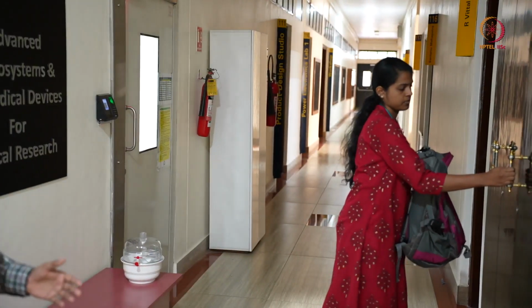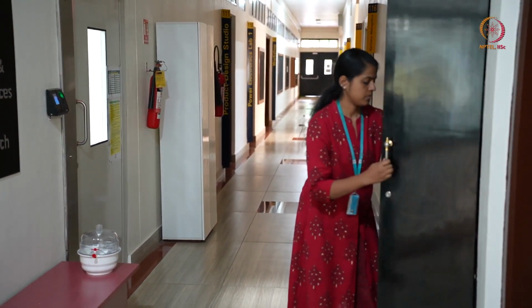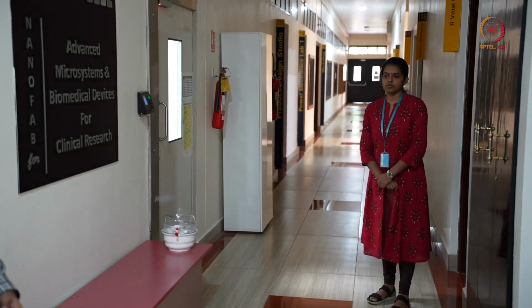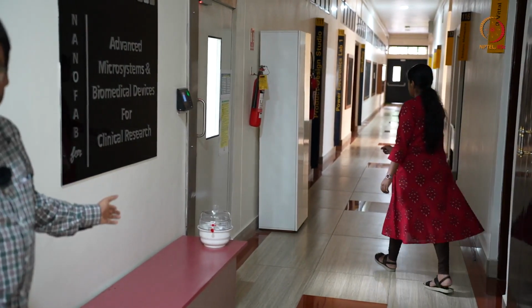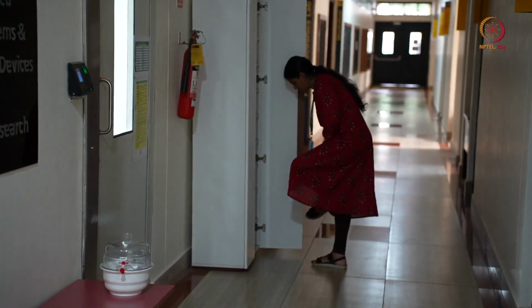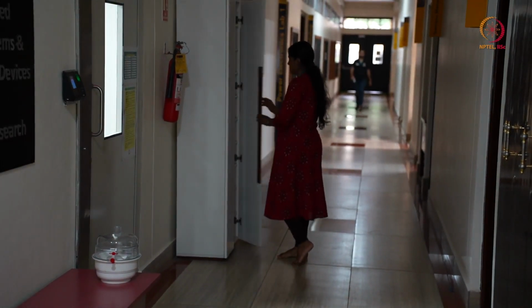So as I told, there are many restricted materials, so you cannot take your bags from outside to clean room inside. So we have separated racks for that. So first thing, whatever you have, basically your sweatshirts, jackets, your bag, any outside material, you have to leave it in rack. Then as a next step, you have to remove your shoes, because outside shoes are not allowed inside. So we have dedicated places for keeping the things in.